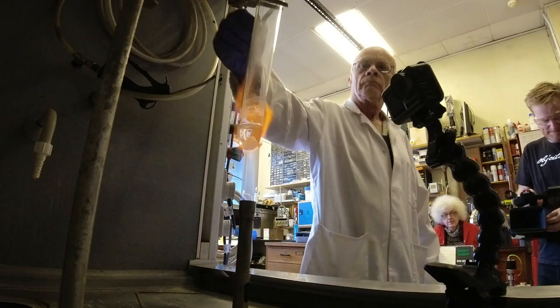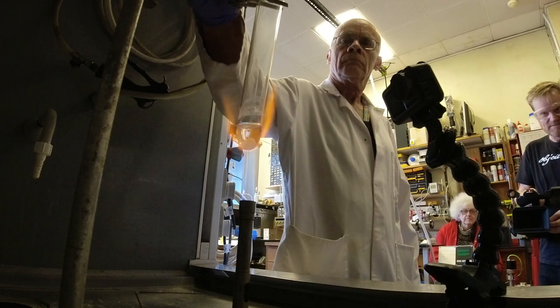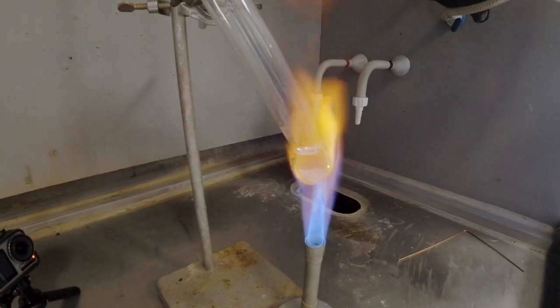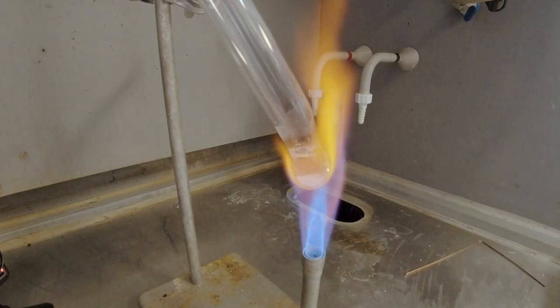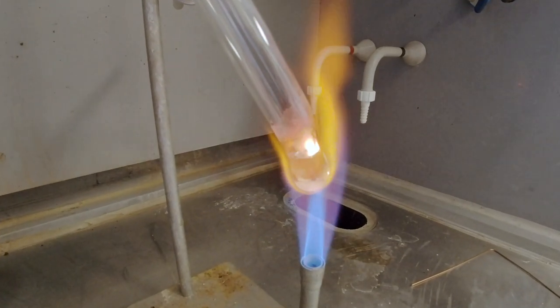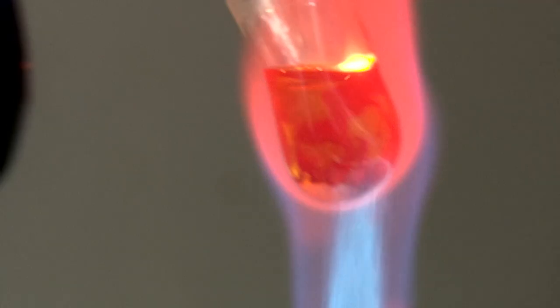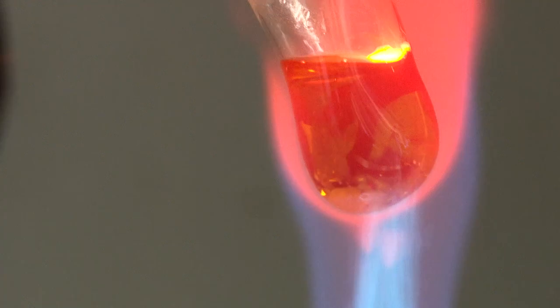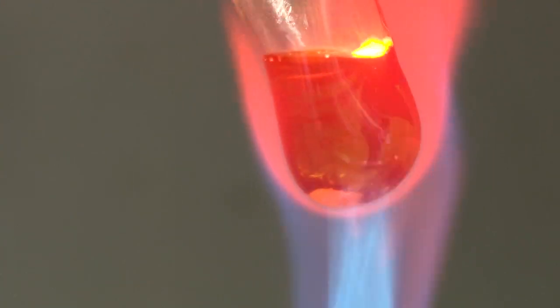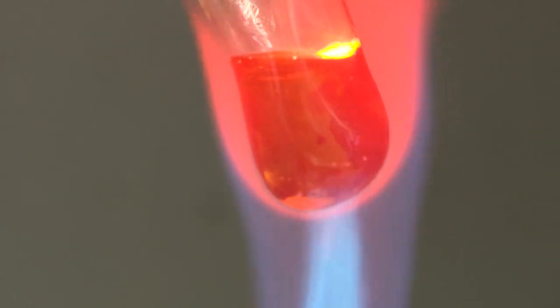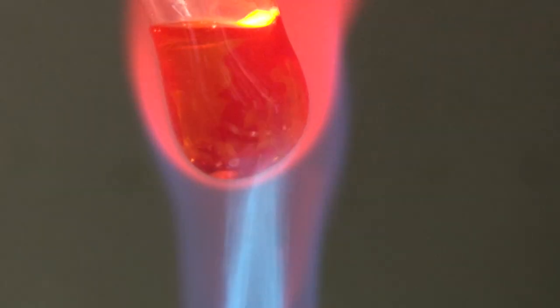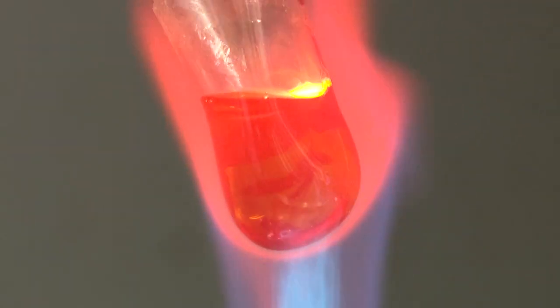And there was quite a bright flash of light. And it continued to flash. Sometimes it pulsed with light with a sort of orange color, which is probably the color of sodium vapor, like you see in sodium lamps. Because the temperature of this salt was well above 500 degrees centigrade. Something's going on in there. Celsius, if you prefer.